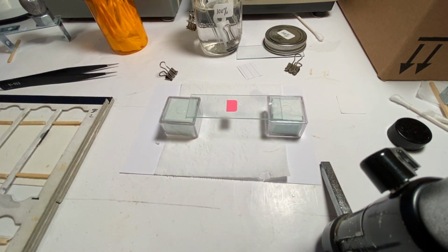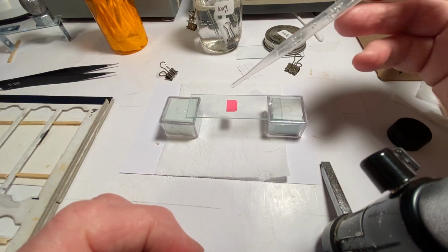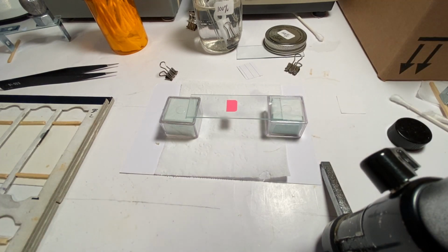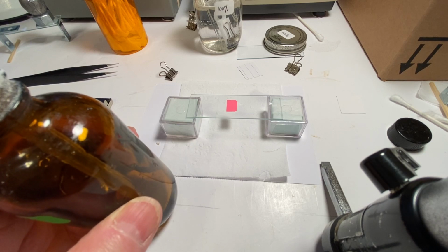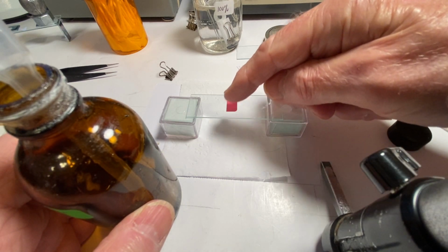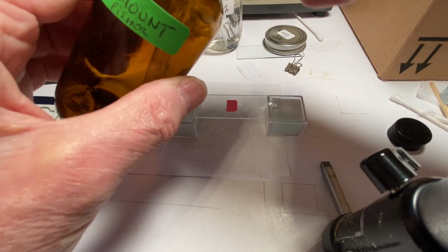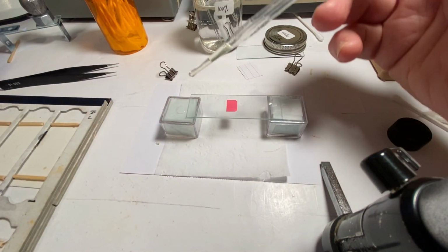So what we're going to do is put some xylene on there. I don't have any xylene right now because I'm indoors, but we can pretend that I just made it a little wet. Now, the insect, of course, isn't perfectly flat. There are going to be some little folds, valleys, little mountains, etc. These are all areas that will pick up air bubbles if you put on the very thick mounting medium. So that's why it's important to flood that area with xylene. You don't want to make the whole area xylene because you want it to be mounting medium, but at least have the insect there. So then we're going to add some Permount now.